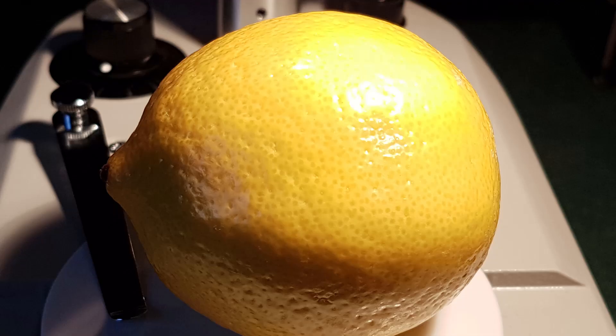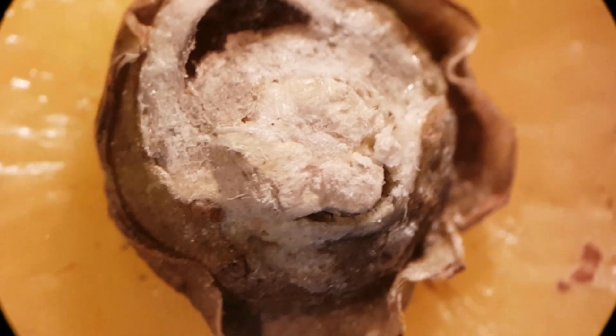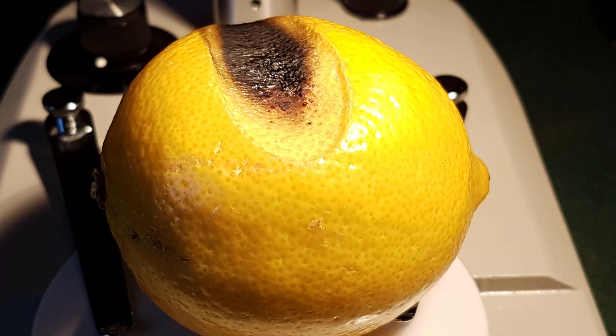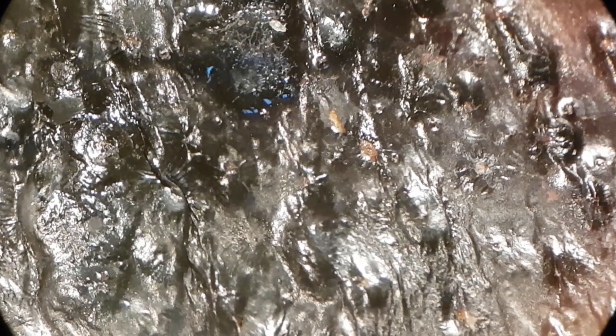Another request was to look at an orange, but I didn't have one so a lemon will have to do. A magnified lemon just looks like a magnified lemon — it's not some secret dimension when you magnify it. Let's look at some damaged skin parts that may be interesting. Here's the little thingy on the bottom of the lemon, and this is the top of the lemon.